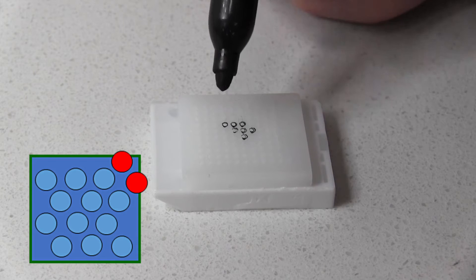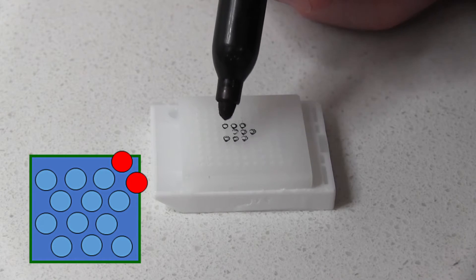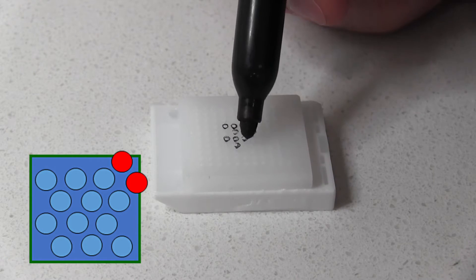Now we can see exactly where we want to insert the tissue cores. Don't forget to mark the control holes also.